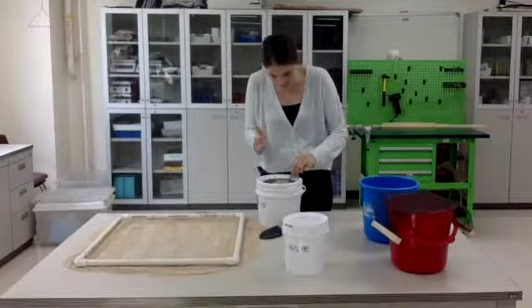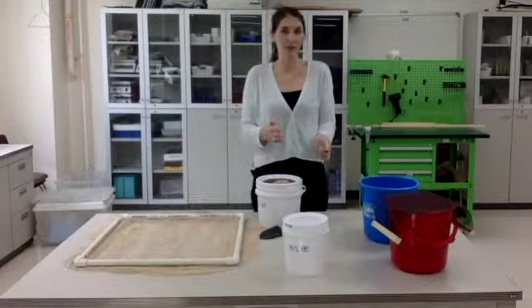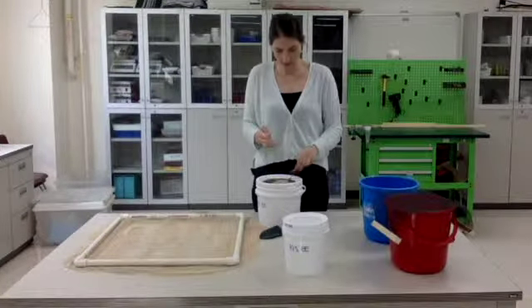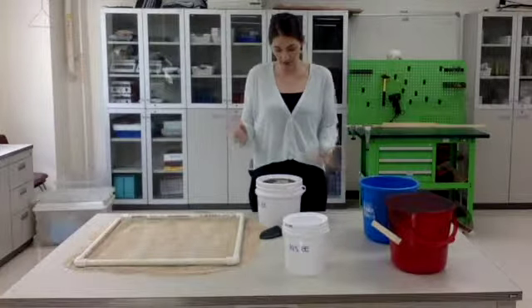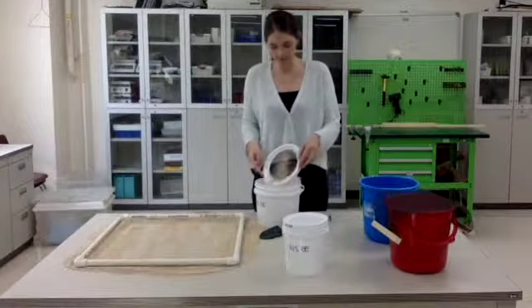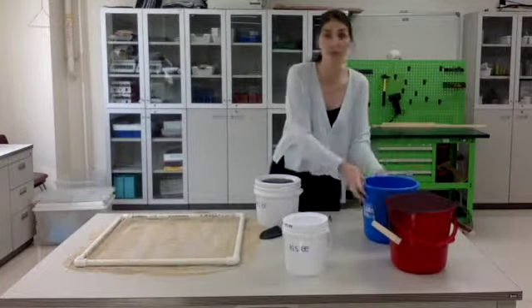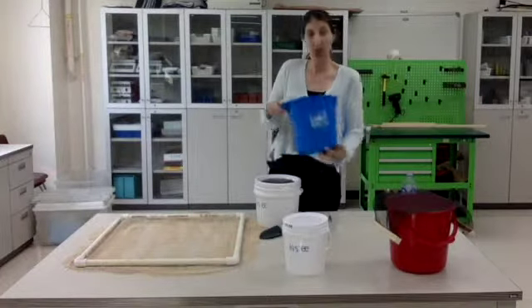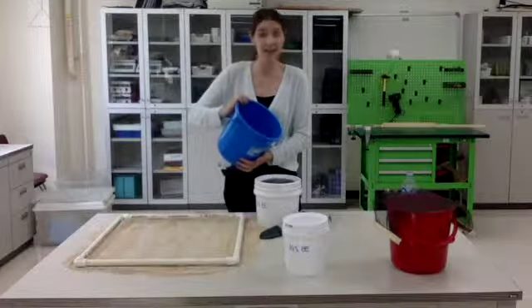Looks like I actually have another piece here. So you may accidentally pick up a piece of shell, and that's okay, because that's what science is. Okay? We're here to observe and figure out what we see. Okay, so I think that I got all of the microplastic out of that one. So I'm going to go ahead and filter it again. And I'm going to try to filter this entire amount of sand that I sampled.